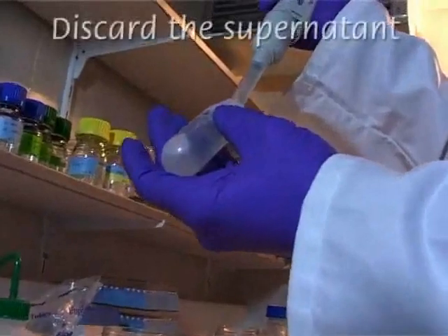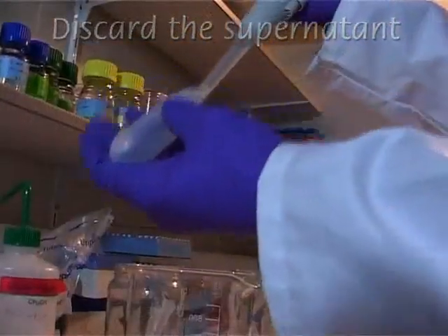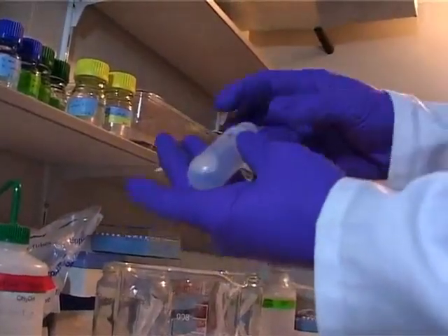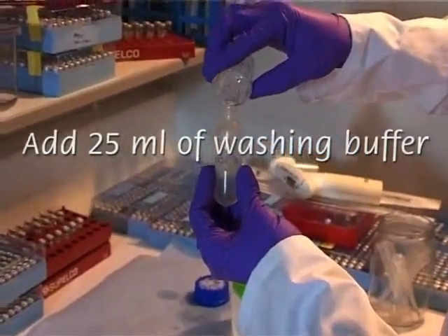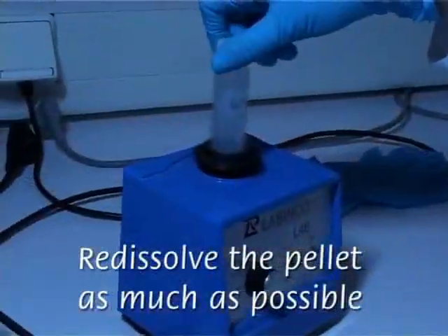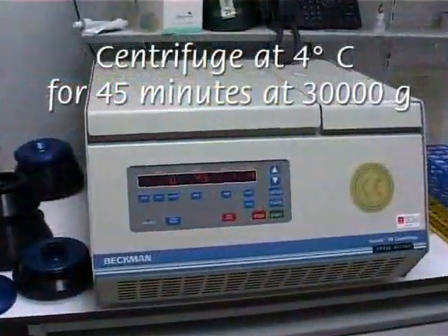Supernatants can be discarded using a 5 ml pipette. TCA is then removed by adding 25 ml of glacial washing buffer containing acetone and DTT. It is then thoroughly and vigorously shaken. Then a new centrifugation step is performed.